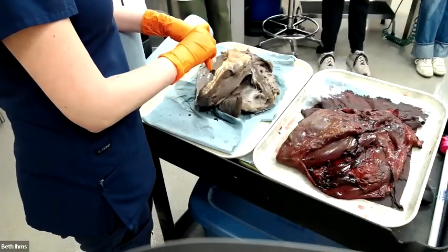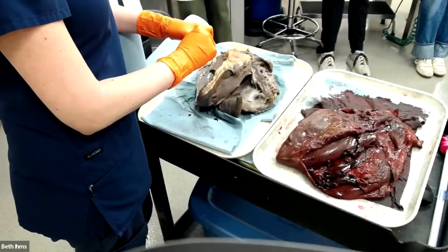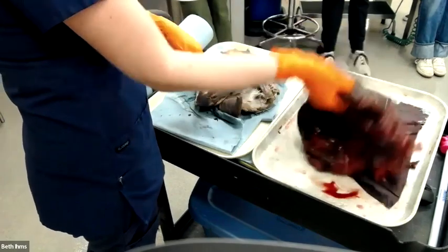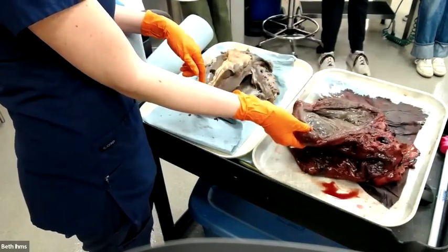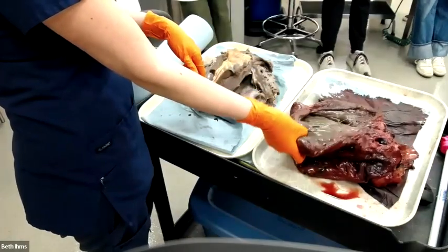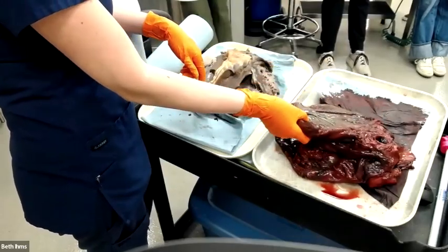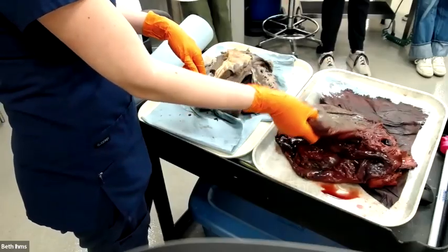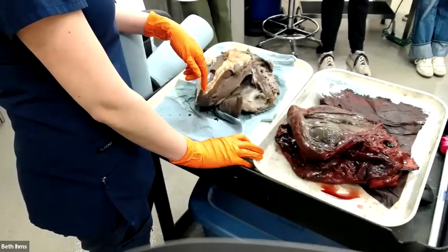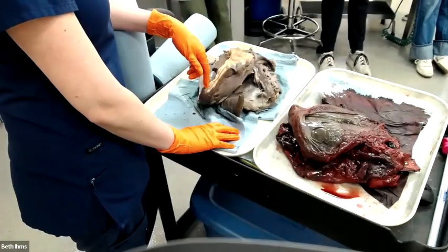Anything else? Other questions, other specimens you're dying to talk about? Last couple minutes. You said that fresh heart is green. Is that just autolysis? What causes tissues to turn green? Pseudomelanosis. There is no gallbladder in the chest that I'm aware of, especially in a horse. There's definitely not a gallbladder in the chest. This is pseudomelanosis. I put these tissues in a bucket with guts. This is bacteria digesting blood. Pseudomelanosis. I created artifacts for you guys to see. You're welcome. Good questions. Pathology tie-dye.